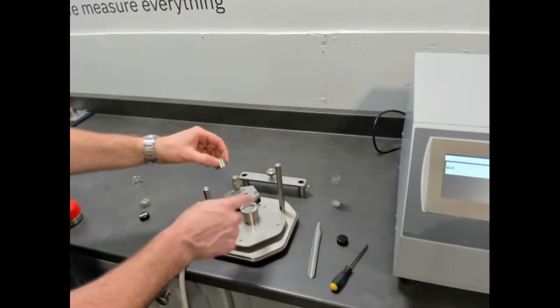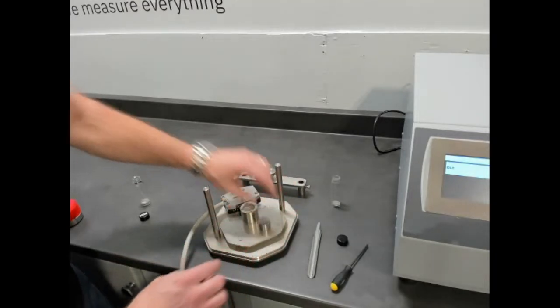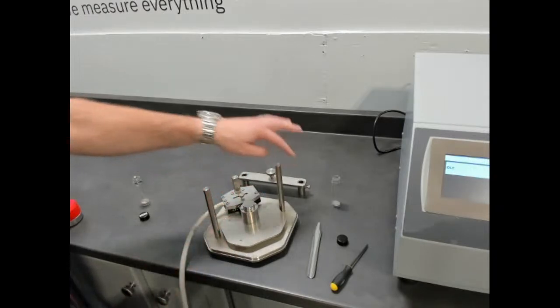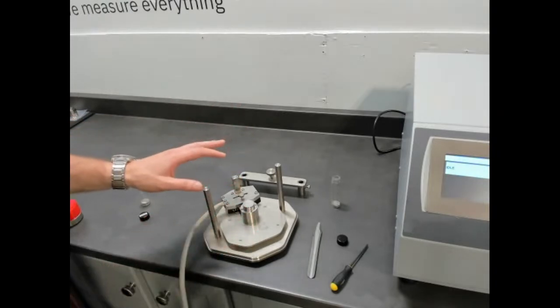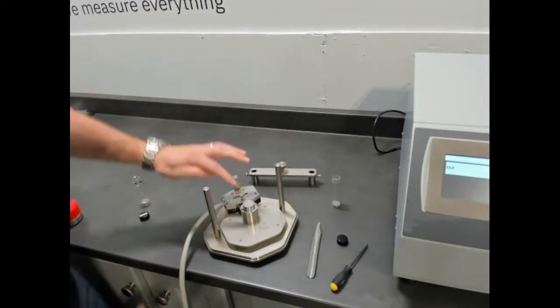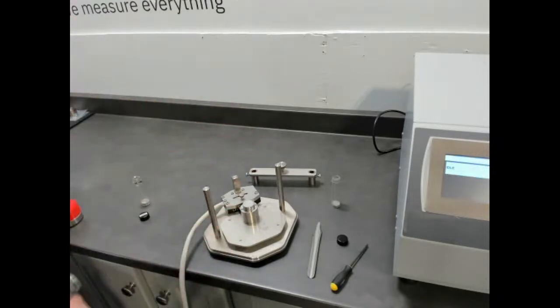The other thing, the flexibility you have with using a weight like this, is that if you put the top bar back on, and graduate this portion, you can vary the density. So if you look at the change in height of that, again, this powder is quite stable in terms of density. Even if you do that, you get the same result. But if you had a material that was density sensitive, if you turn the set screw on top and look at the change in what's on the top, you can graduate that and see the change in density. So it's a little bit more flexible in that way, but you can do the exact same thing on the MTPS sensor.